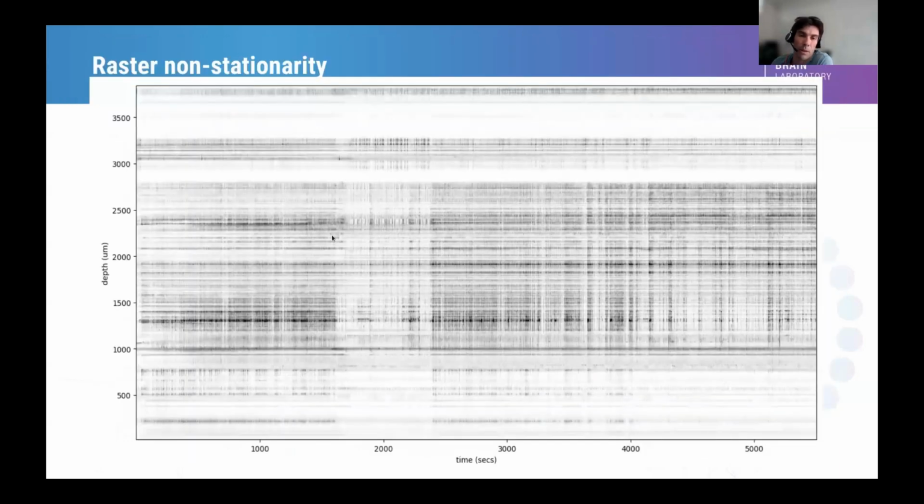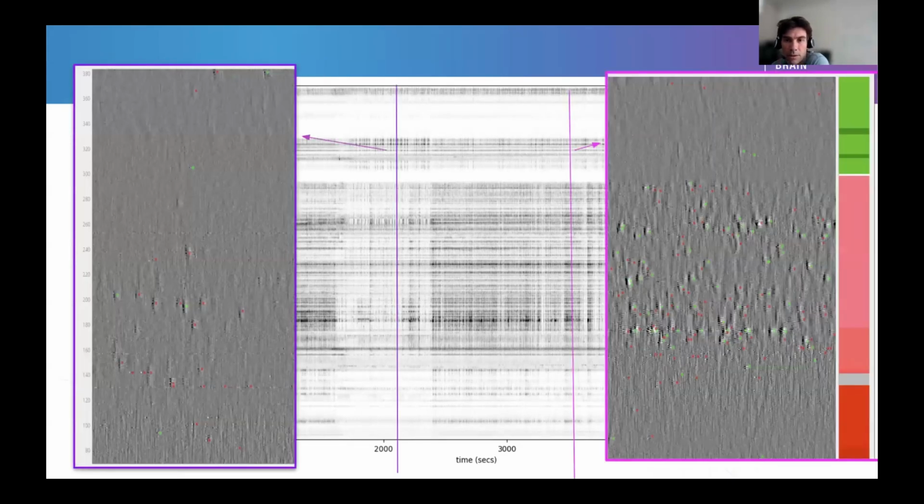The conclusion may be that the non-stationarity seen on the raster is indicative of a raw data quality problem. And here we see a huge non-stationarity in the middle of the session. And we could think that the raw data is wrong behind this. But actually, if we look at the raw data in those examples, we can see that in both cases, even if they look very different, the raw data quality is quite good.